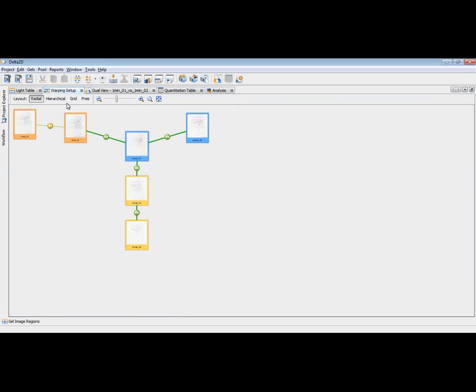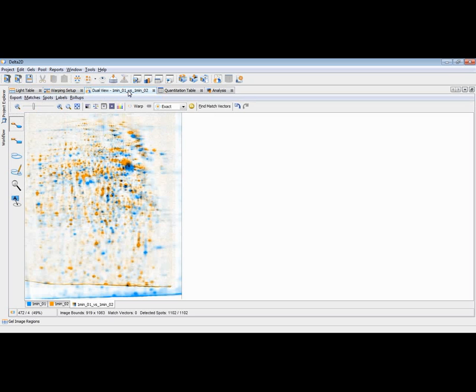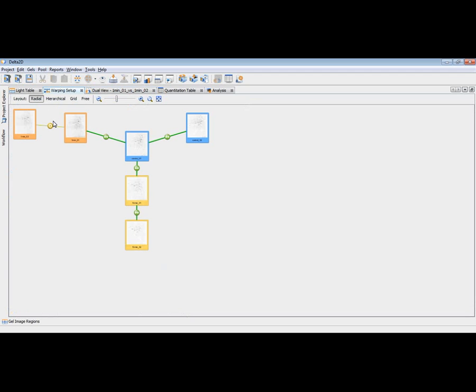Now, since the match vectors are deleted, you can see in this warp setup this first bullet here, and it would even change since we recommend also to let the automatic warp mode give a try, and then this becomes a symbol like this. That means there is a connection defined. It's not yet calculated, but Delta2D can do this automatically and at least guess some matches and match vectors. Let's have a look how this is done.